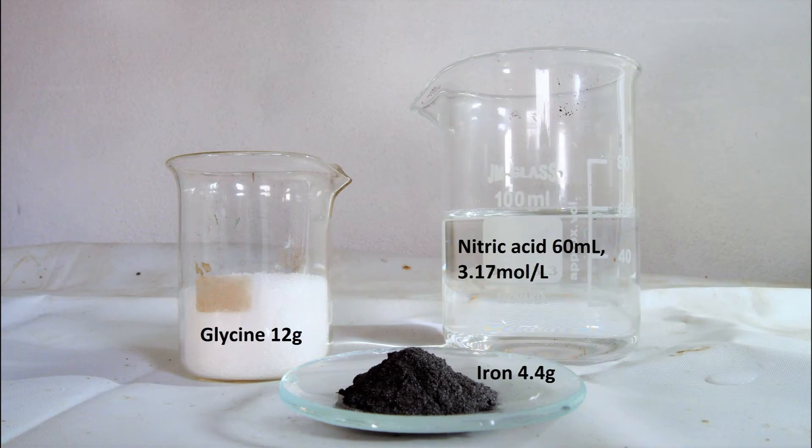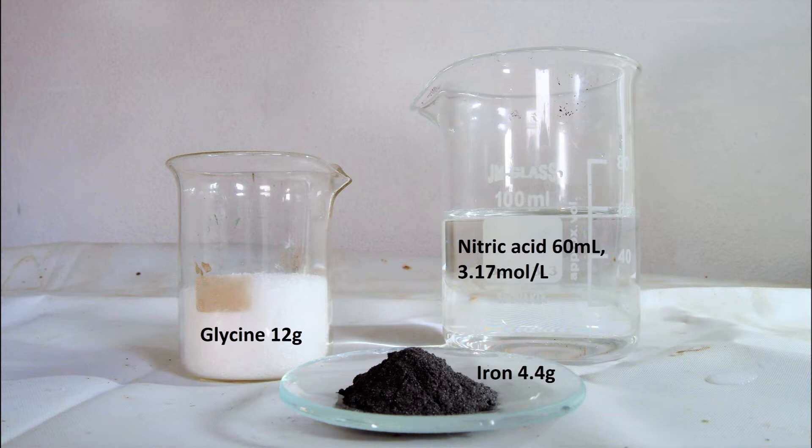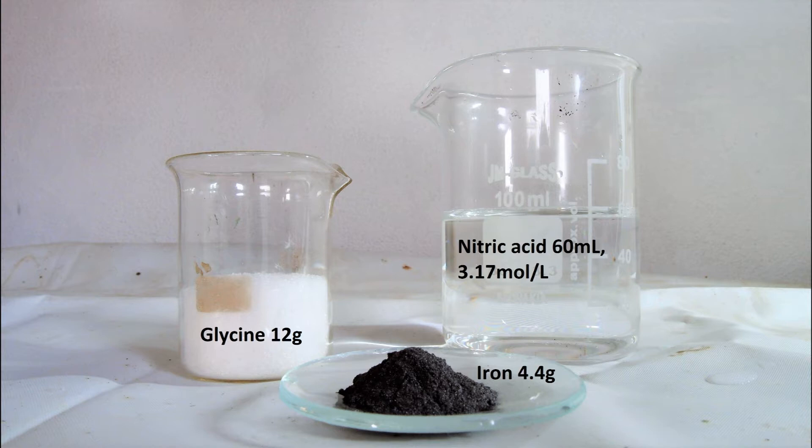Hi everyone. In this video I want to show you a very interesting and effective method for the synthesis of nanoscale materials that has been used in the production of various ceramic powders for a variety of advanced applications. Specifically we will be making nano-sized ferric oxide powder.